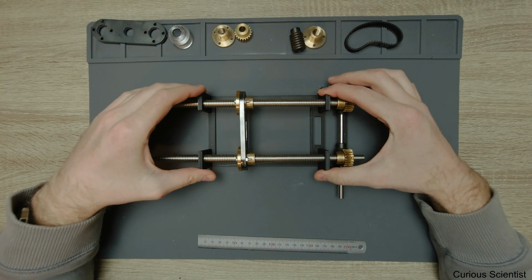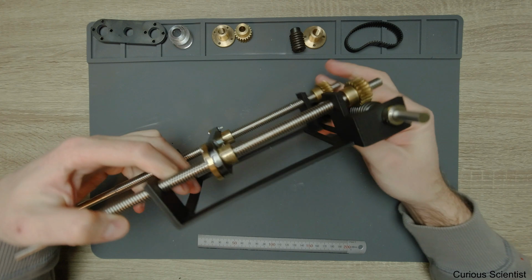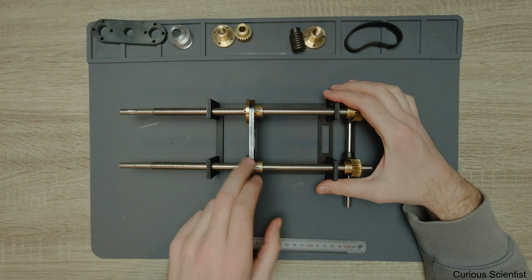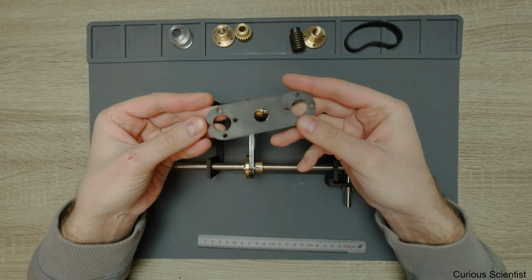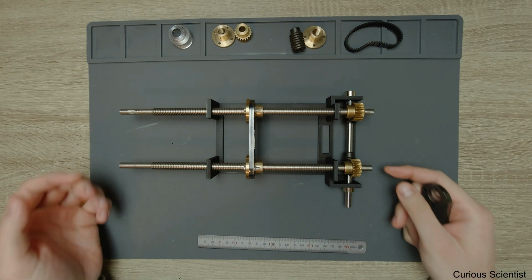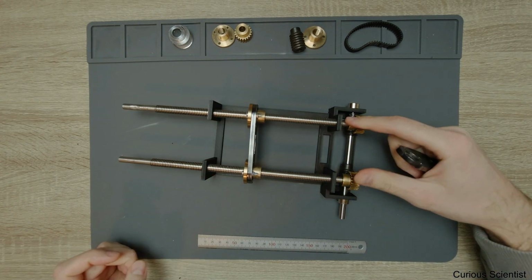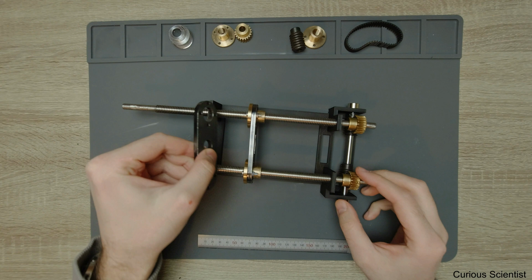So this black frame or structure is a plastic 3D printed structure, as you can see. It's nothing fancy. And then the new tensile testing machine and the main part of it, which is basically the crosshead, will take place between this area, between my hands. I could not put the other side, this guy here, on the other side of the thread, because the threaded rod is a bit too long and I could not squeeze it in, because as you can see, these parts are closed here, so you have to put the thread through these holes and then put on these nuts as well, and then slide it back, and you should put this on the other side.